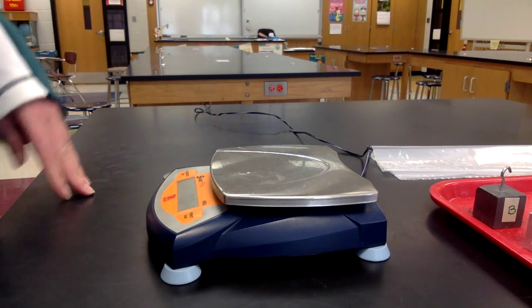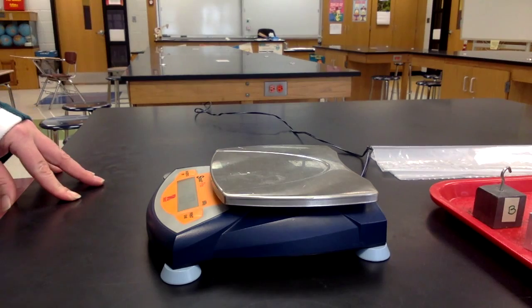To measure the mass of a gas, this is very similar to measuring the mass of a liquid.